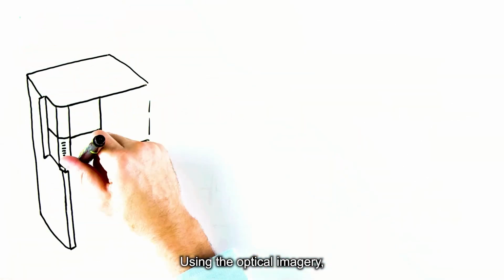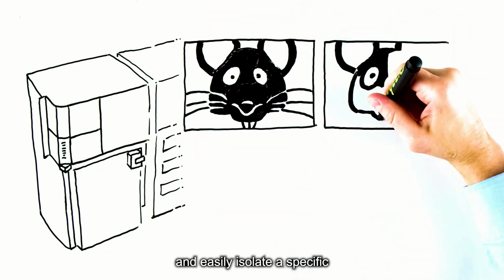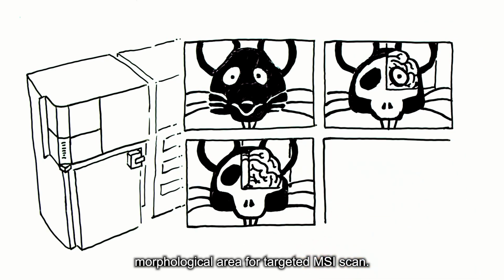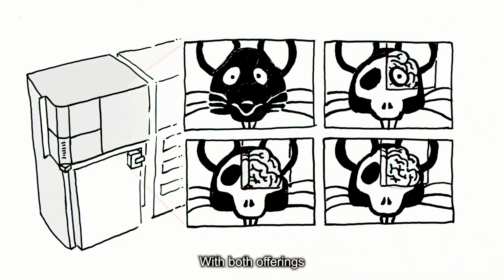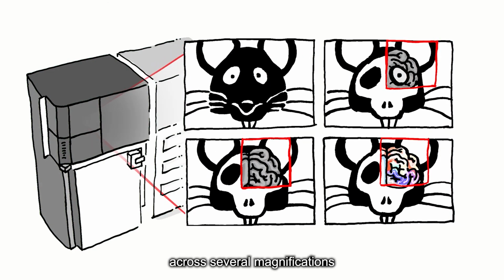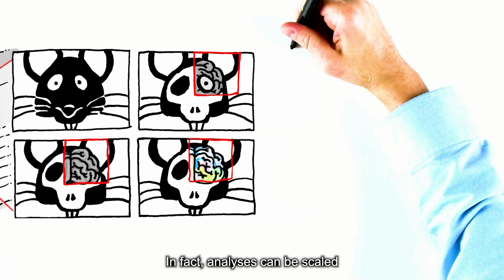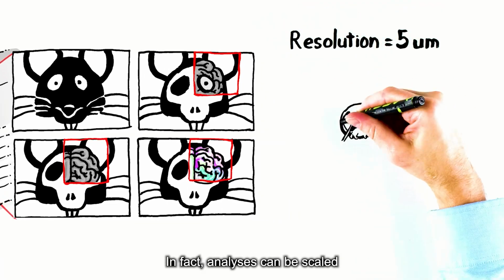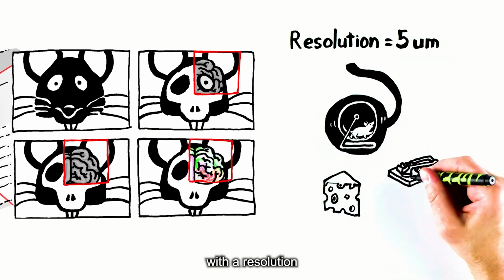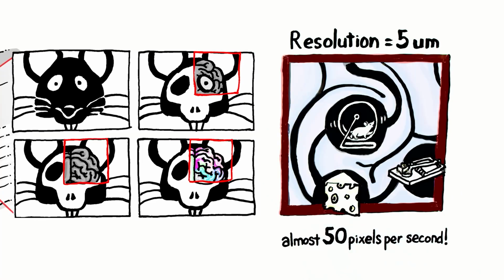Using the optical imagery, operators can quickly define the contours of a target and easily isolate a specific morphological area for targeted MSI scans. With both offerings in the same instrument, optical and mass spec data can be captured across several magnifications without user intervention. In fact, analyses can be scaled from the entire sample to microscopic regions with a resolution of 5 micrometers at almost 50 pixels per second.